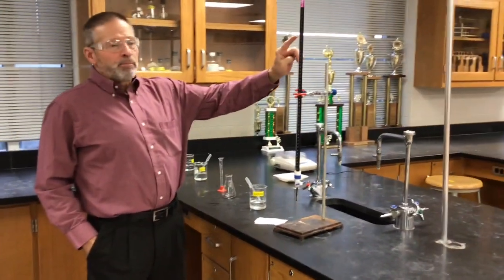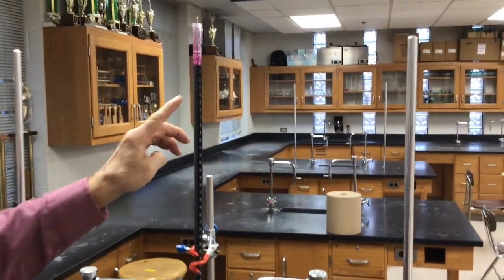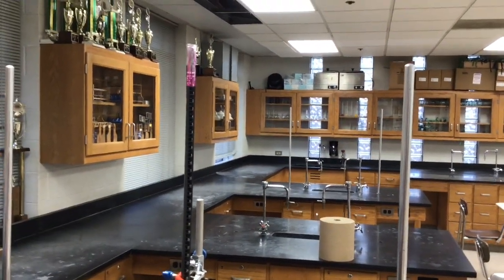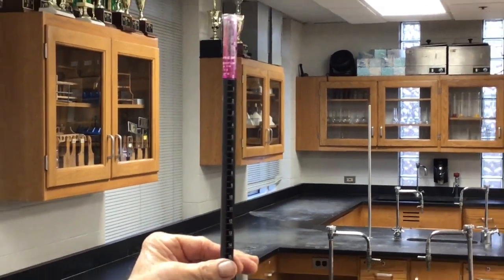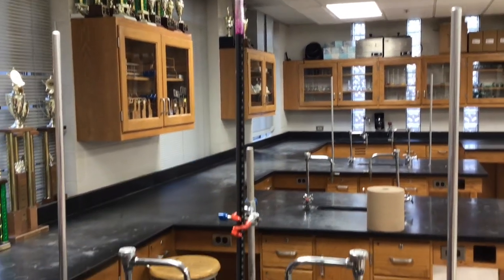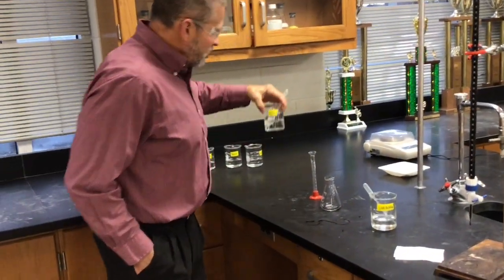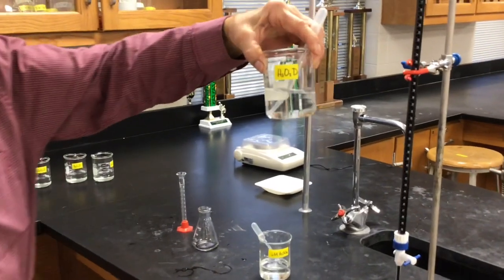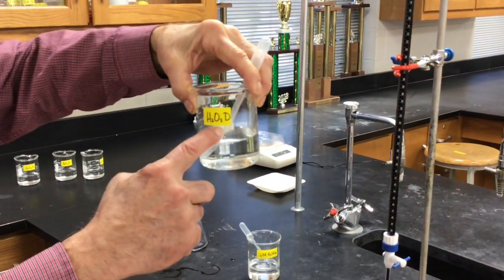So we're at our chemistry lab station. All right, yeah, here we are. Time to do the titration. As you recall, we said the permanganate was going to be in the burette. It's got a beautiful color. And recall, we know this concentration is 0.150. Okay, so we'll use that permanganate then to titrate against our unknown hydrogen peroxide solution. You are using sample D.